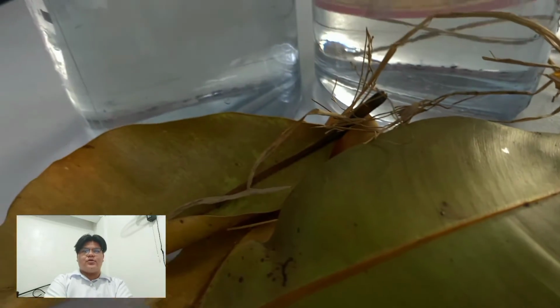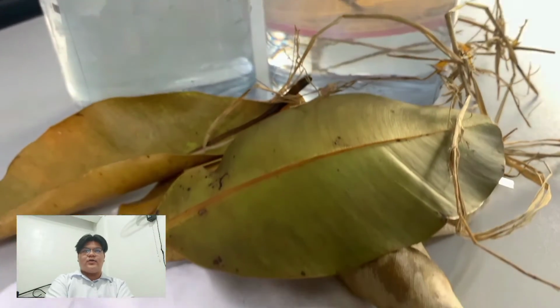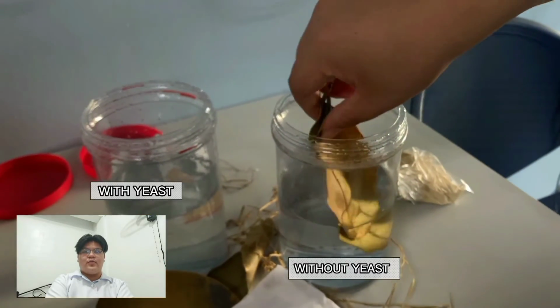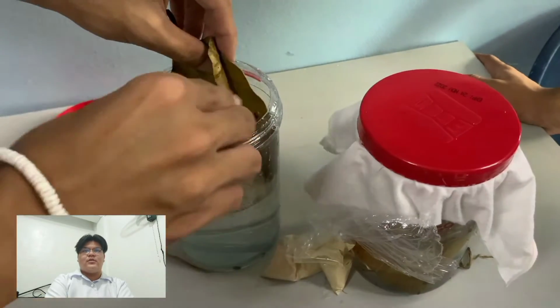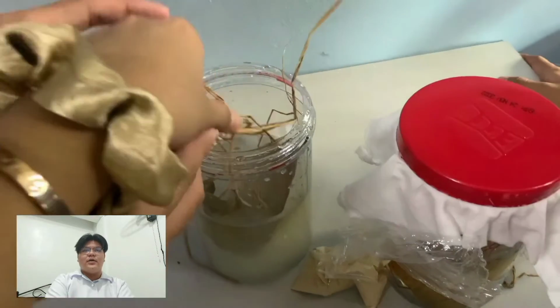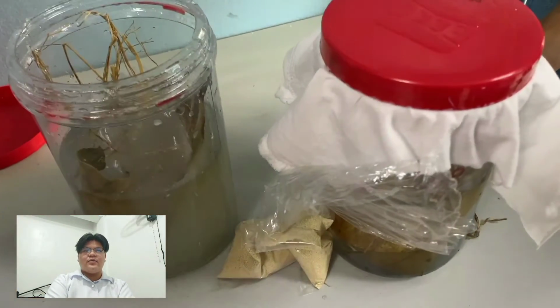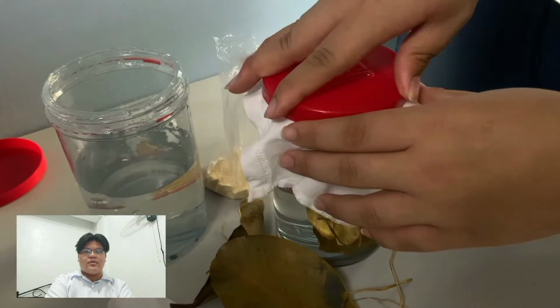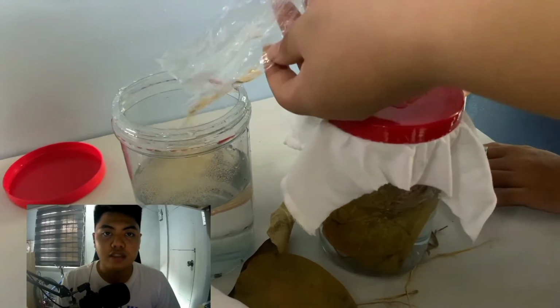During infusion preparation, you need to fill a container half full of non-chlorinated water or any spring water. But if you cannot find some spring water, you can also use rainwater so that the protists can grow properly. Then put a small handful of dried leaves or any other dried plants inside the container, filled up with the water. It is the protist food, so make sure they are submerged. In this way, they can eat and start to form. And now, you can add the yeast inside the water, because it can also be their food.